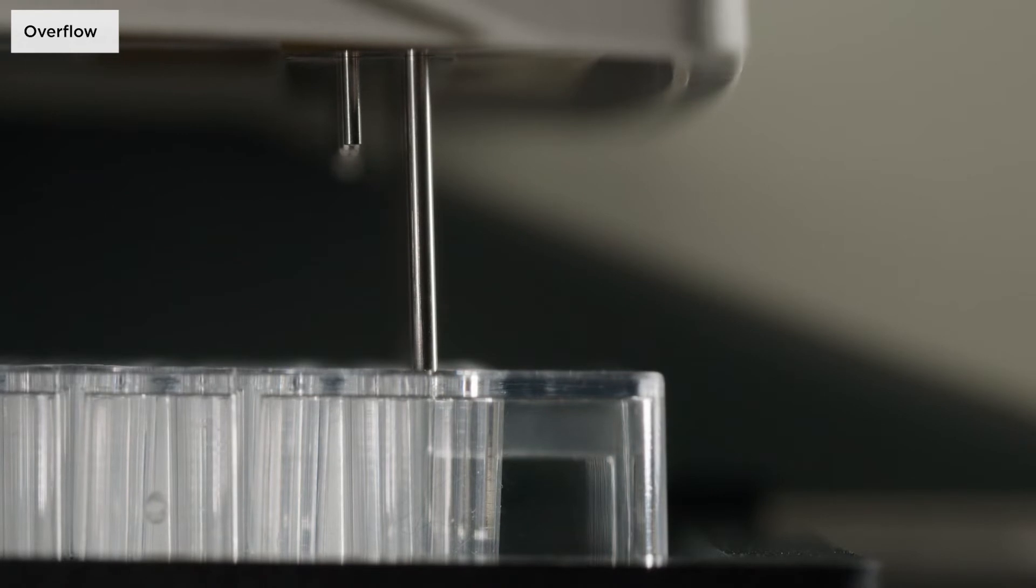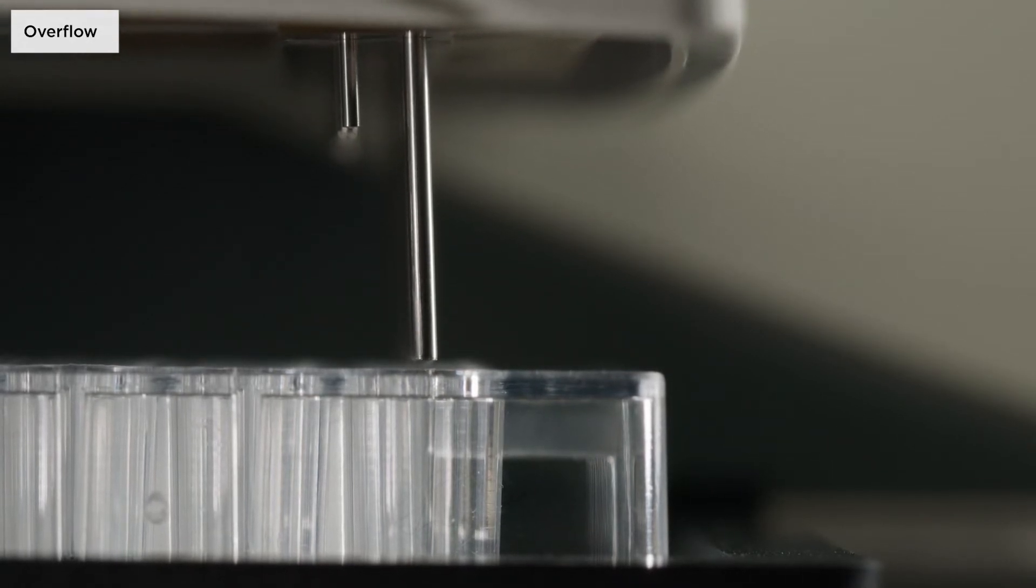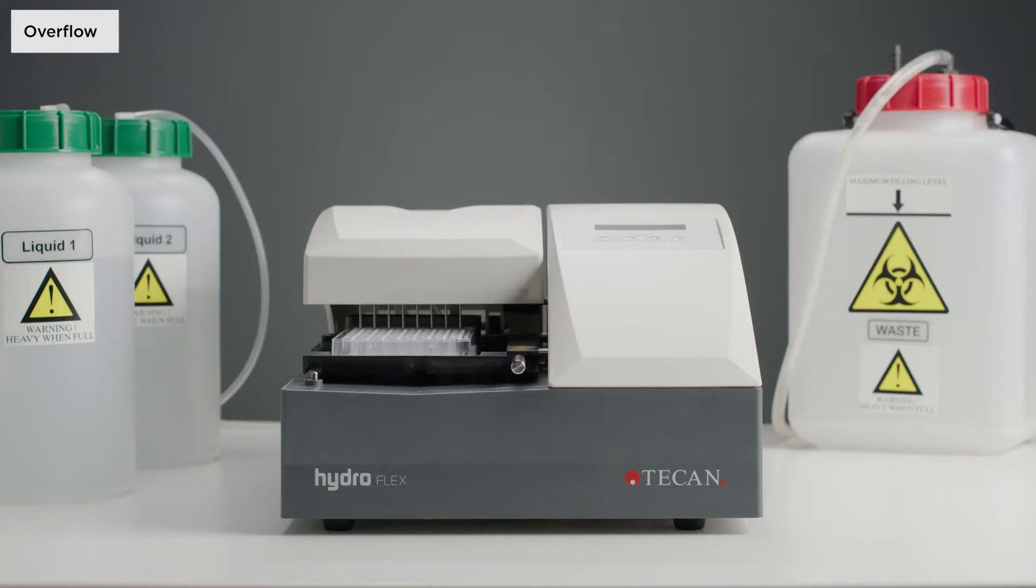Make sure that the overflow Z position of the aspiration needles will not lead to overflowing wells, liquid spills, or cross-contamination.